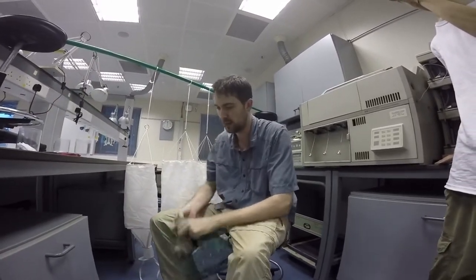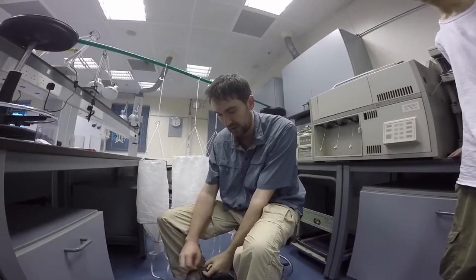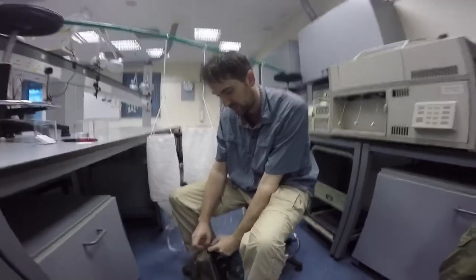For that, I'm actually going to put a glove on, because here in Hong Kong we have a lot of ants, especially Ponerines, that can sting you — which I actually got stung by earlier — and this is not a pleasant feeling. So gloves will actually prevent those kinds of things from happening.